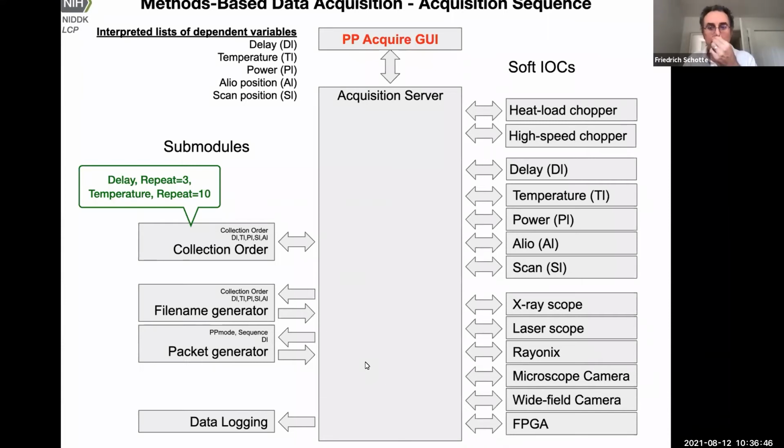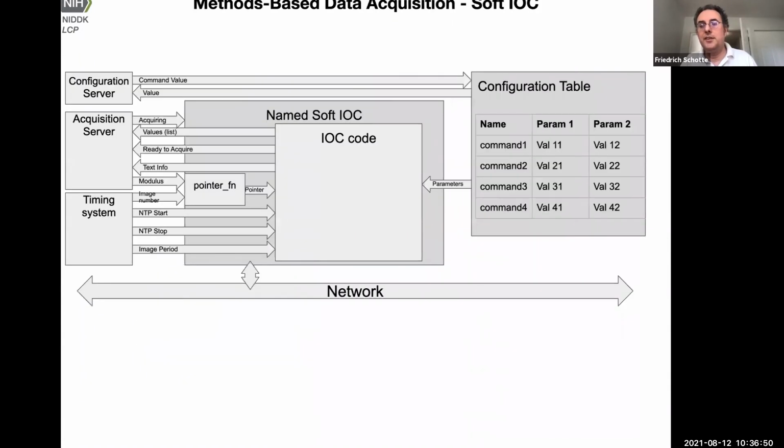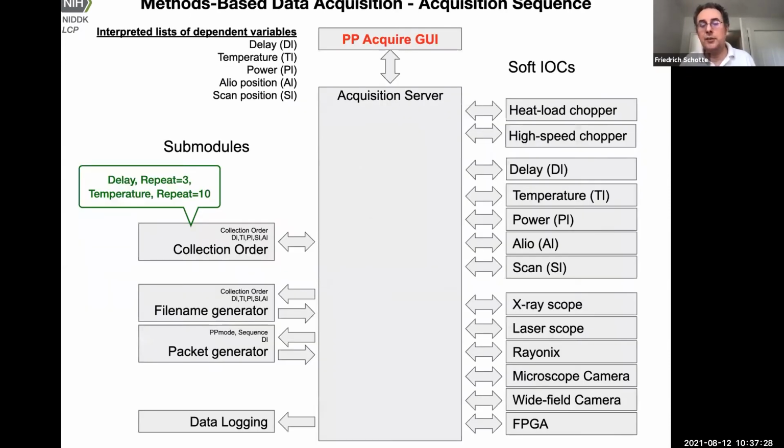So that is the design principle behind it. These soft IOCs or subsystems here, it is not fully implemented yet, but they are supposed to have a standardized interface to interact. So it's easy to make the system extensible. If you have a new piece of hardware you want to add, for example, a high voltage pulser or something like this, you could write a dedicated IOC for this. With all boilerplate code around it, you only have to put some core code here to actually talk to the hardware. The acquisition server wouldn't have to be modified. It would just have to be made aware that there's another scan variable by adding it, linking it to the table.